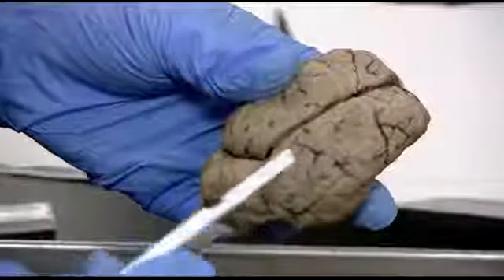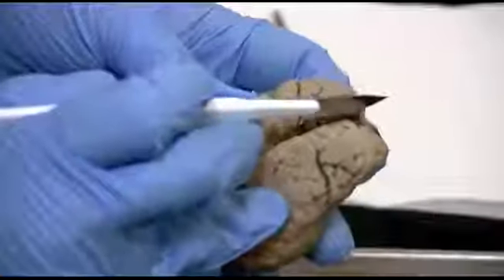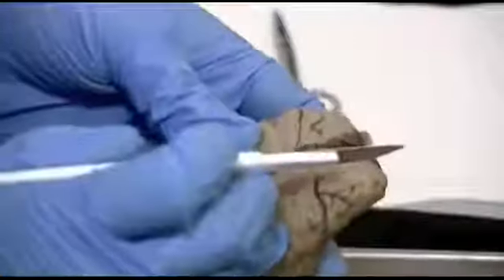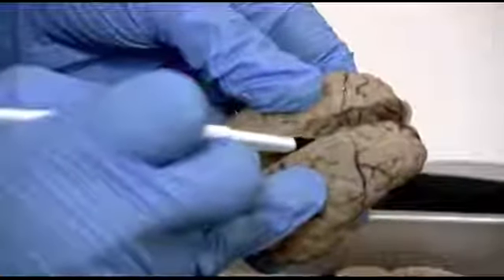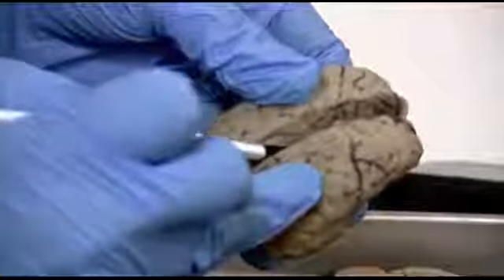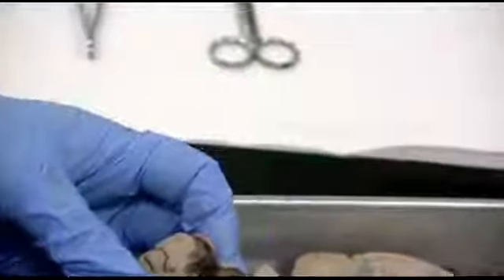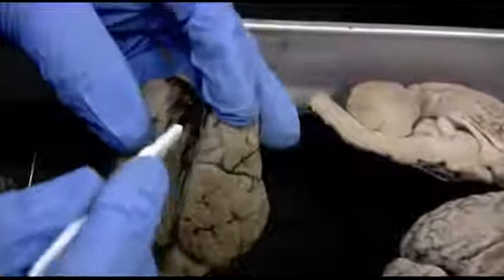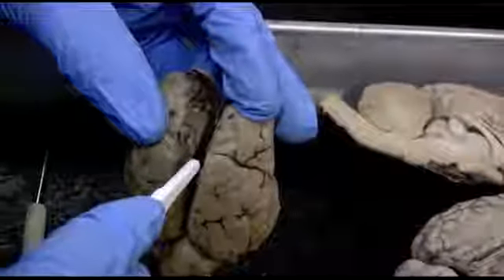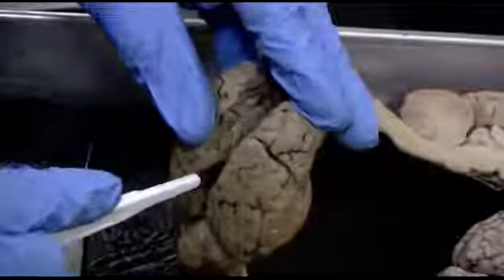Okay, I'm ready to make a cut with the scalpel here. Be careful if you're ever doing this not to cut off your fingers and hold it like I'm holding it. You probably want to have it down in the tray, but I just want to show you you're only cutting right in the center here, and it's really gentle cuts that you can make. It doesn't take a lot to get it to separate. I'm going to put it down here and see if I can just work down the center. You want to be as exact as possible so you can get a good view of the structures right in the center.